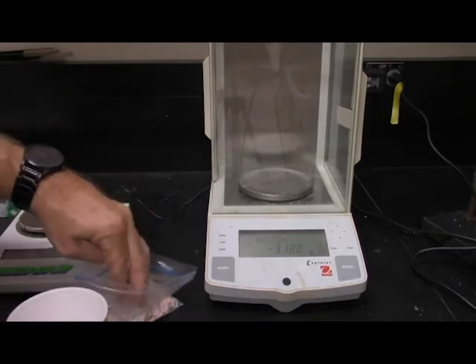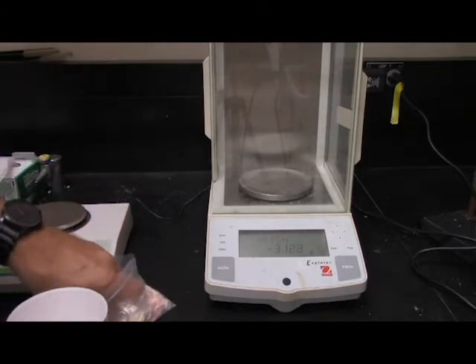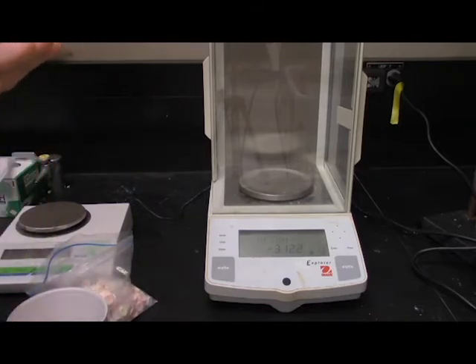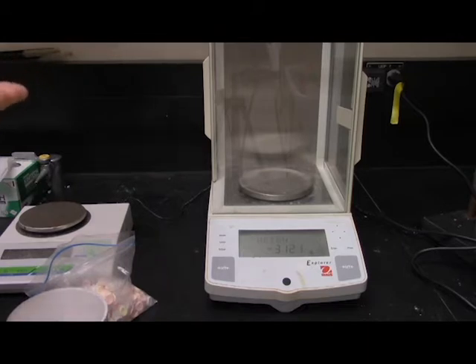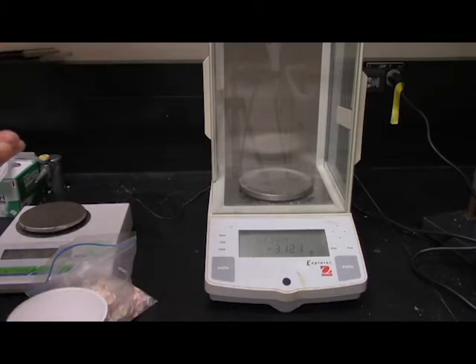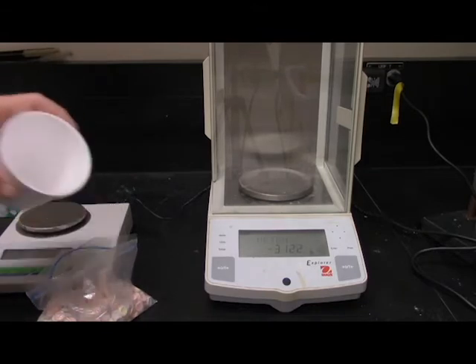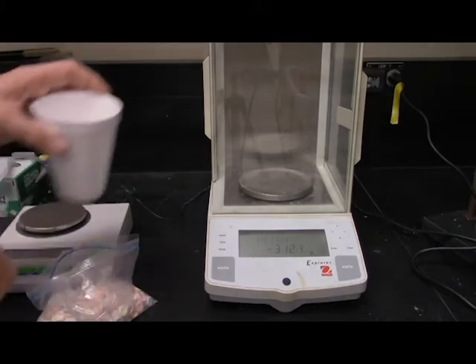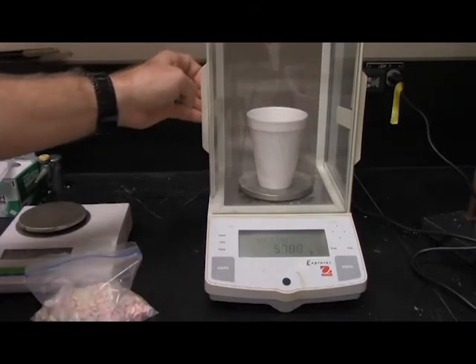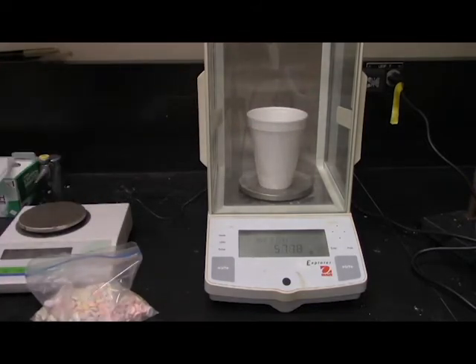And then we take those out and we grab 12 more. Of course we have to repeat our measurements a couple of times. 1, 2, 3, 4, 5, 6, 7, 8, 9, 10, 11, 12. Put those Smarties in. And dutifully write it down.